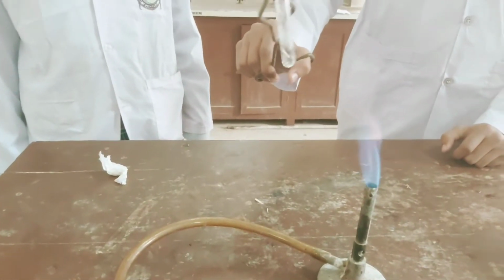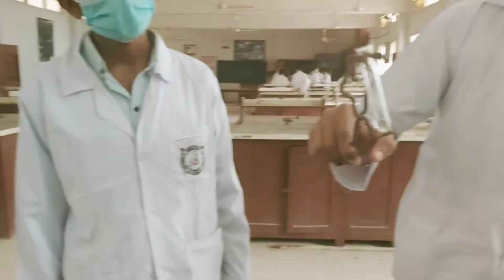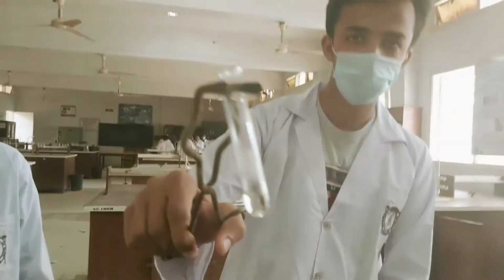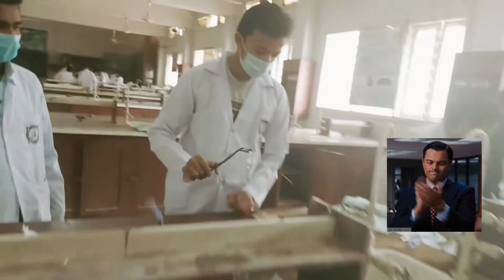Right. Soluble when you are warming it. Yes. Okay. It is soluble on heating. Bring it a little bit closer. Sure. Great. Record your readings.